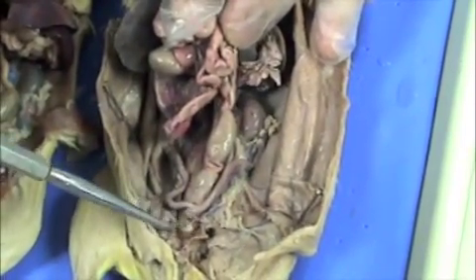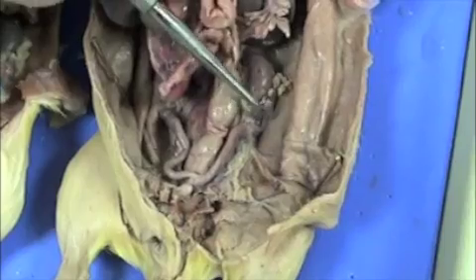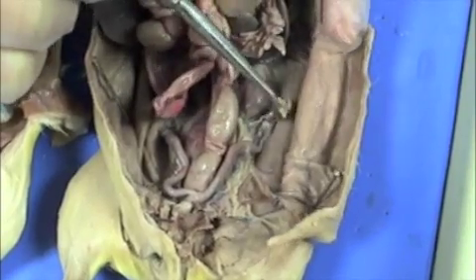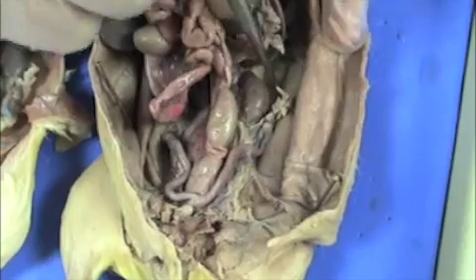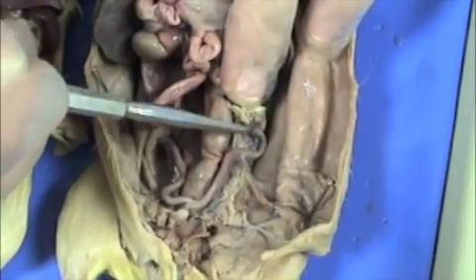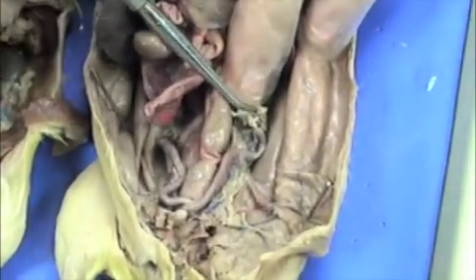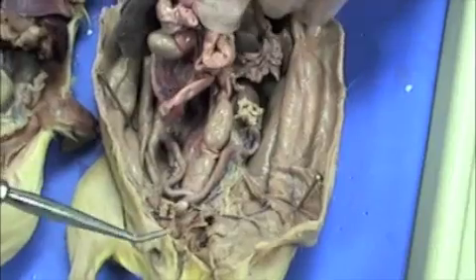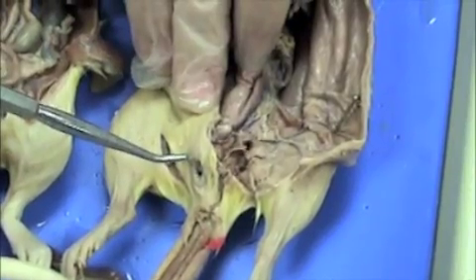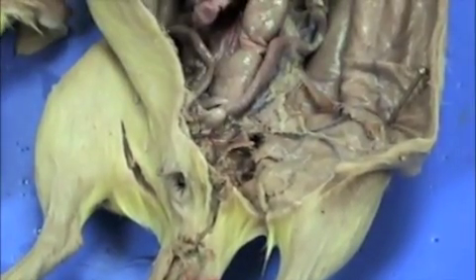This is the bladder in the pelvic cavity. Here's the uterine horn — you may not need to know uterine horn for your test, but you do need to know this is the ovary up here at the top of that uterine horn. It's got a lot of tissues around it, but specifically the ovary is that little brownish ball right here at the top. Come down into the pelvic cavity and we have our openings: the urethral orifice, the vaginal orifice, and the anus located here.